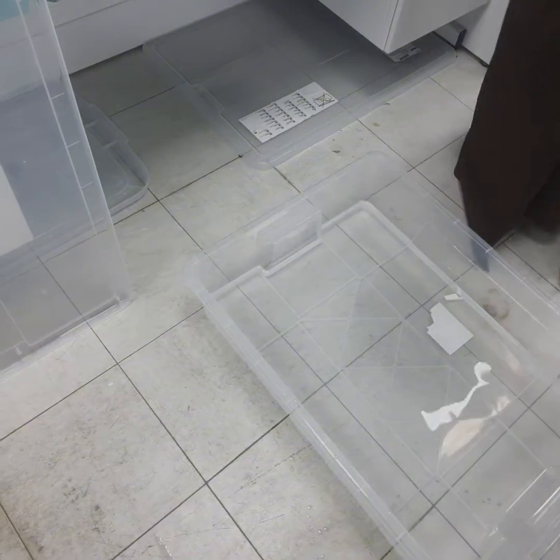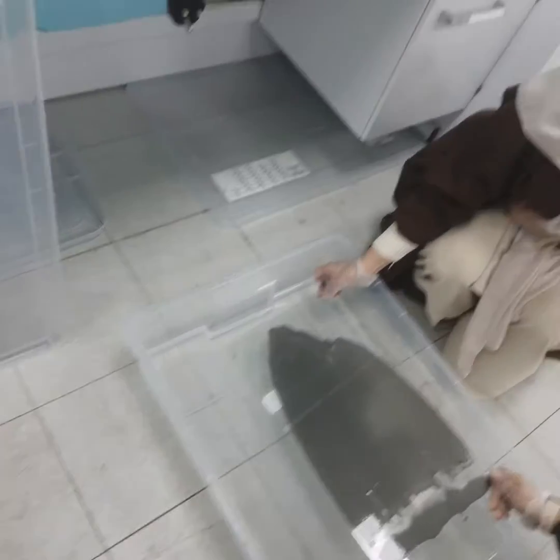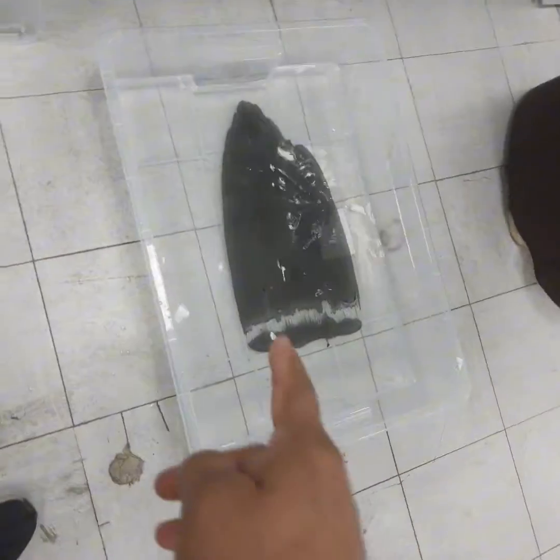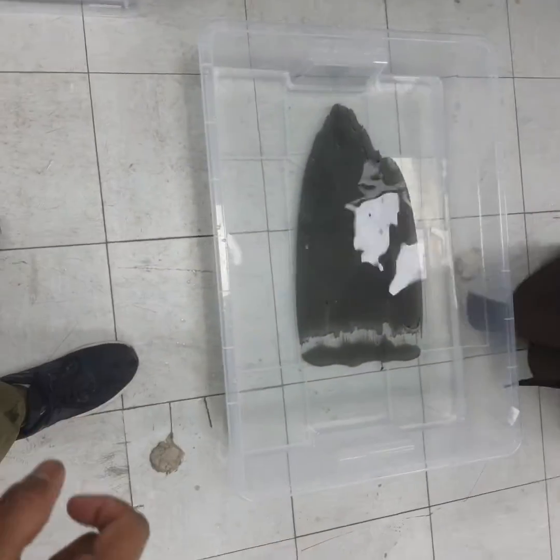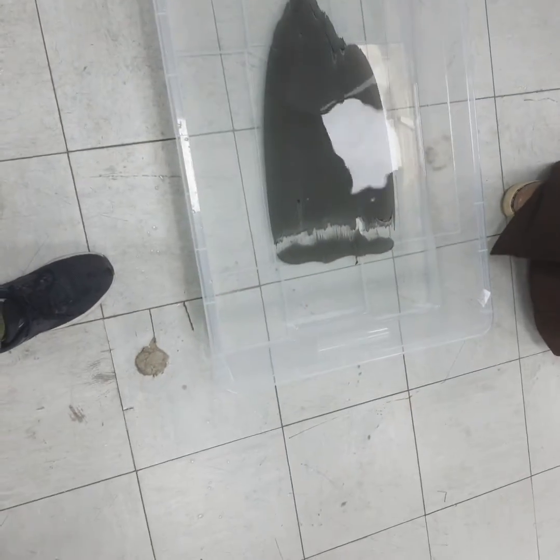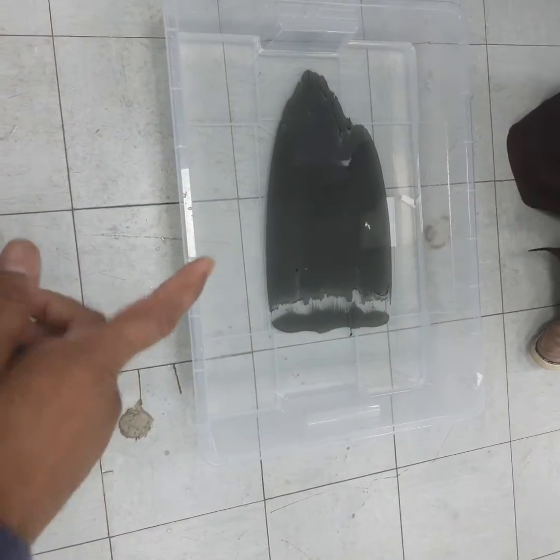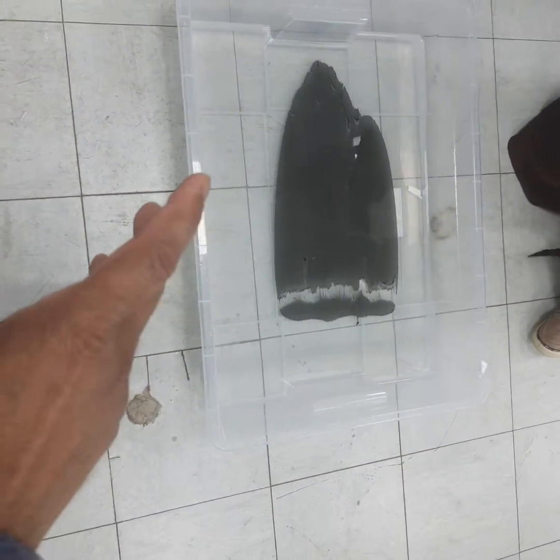Add it carefully, both of you. Leave the plate, please. That's great. Slowly, it will leave the surface. We need to be careful about the temperature of the water, and about how long you leave it here. You cannot leave it overnight. As soon as it leaves the surface, you take it out and spread it on aluminum foil or whatever you have, but on a clean area. It has to air dry. Usually you can air dry it, or you can dry it in the oven, but the temperature should not be more than 40. Okay, clear?